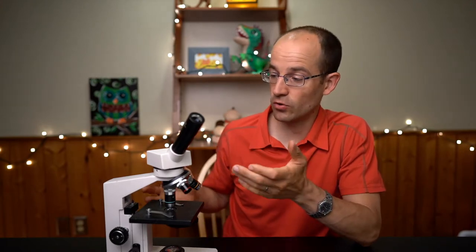So today we are going to be looking at the microscope and this is the model that we'll be using. It is an older model. It is going to work out just fine though.